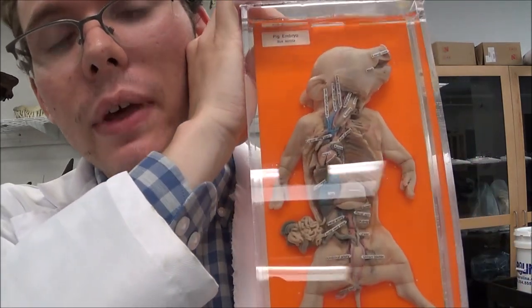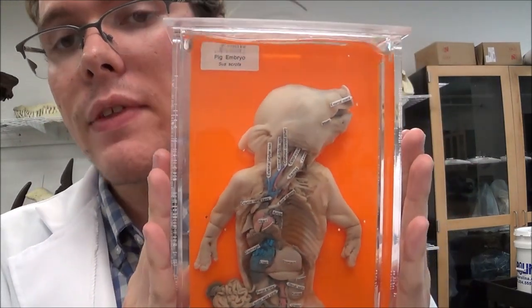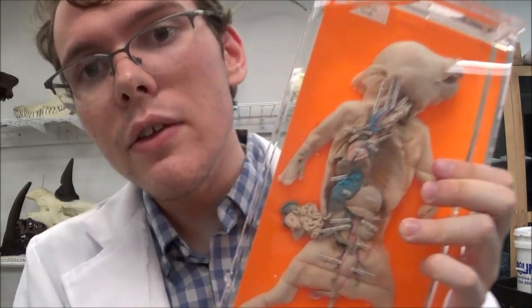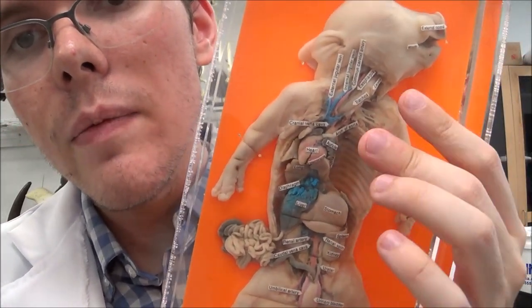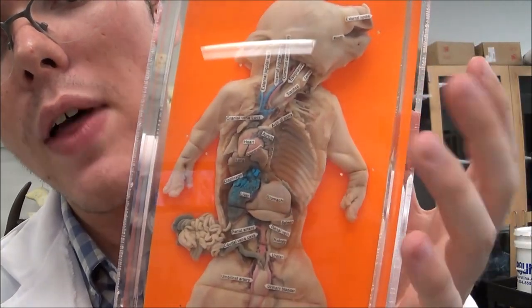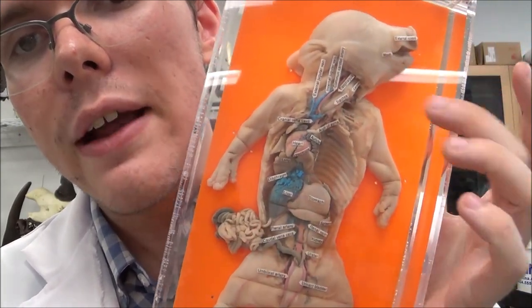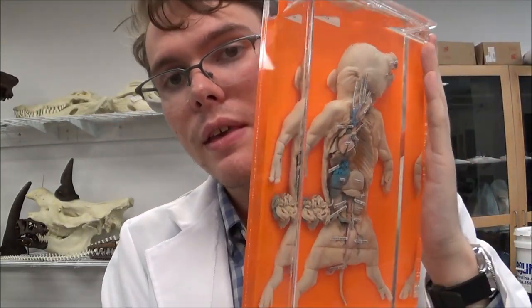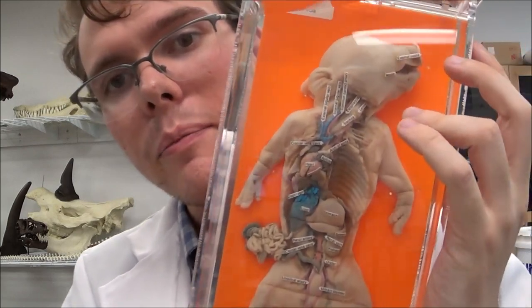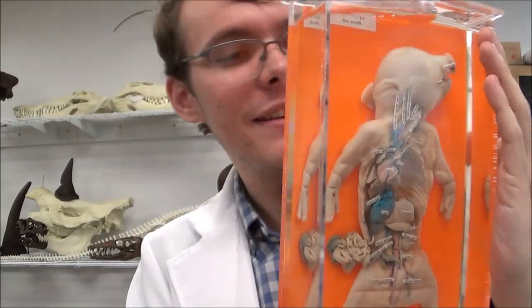Our last specimen for this video is the expertly dissected fetal pig at 80 days of development. It's still considerably smaller than the specimens we dissect in lab, but you can see it already has all of the basic anatomy parts built in. At this stage it already has a fully developed heart, lungs, liver, stomach, and intestinal tract — all it has to do now is grow and get bigger. You can see it very clearly against this interesting orange background.